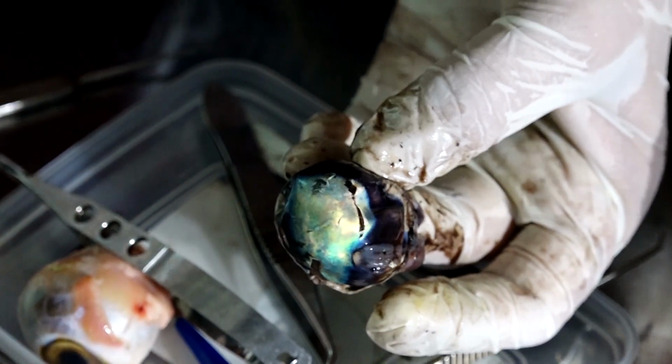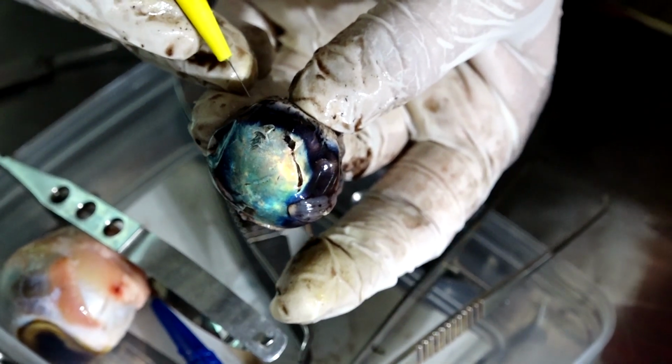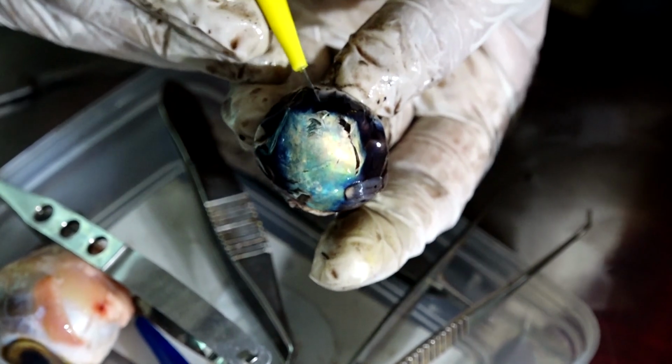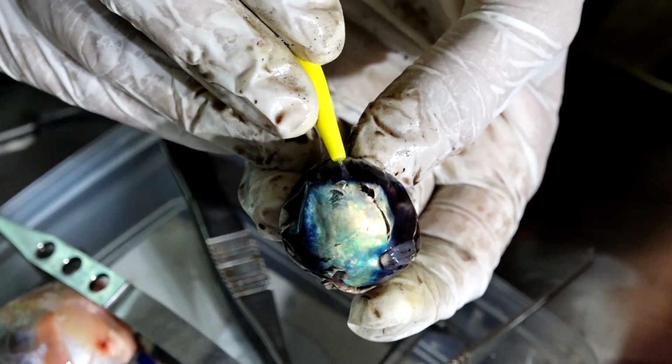Yes. So this is called the end of the retina, which is called the ora serrata. So the edge of the retina which ends at the most anterior part is called the ora serrata. I am putting a blade beneath this.